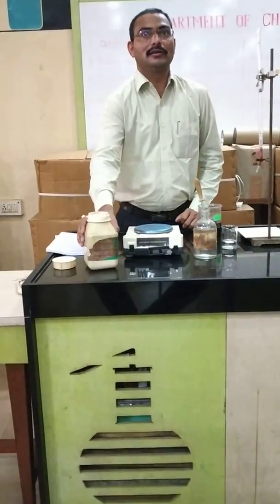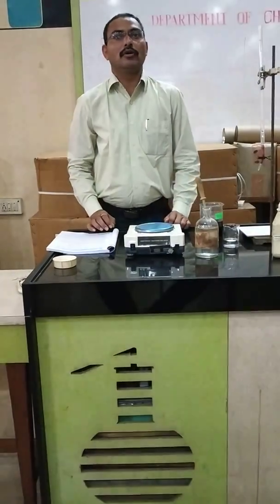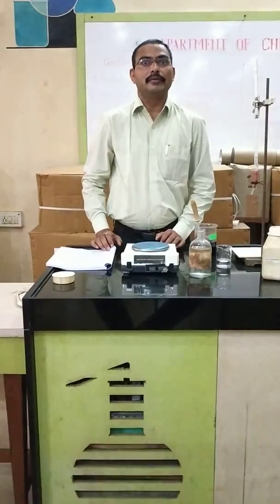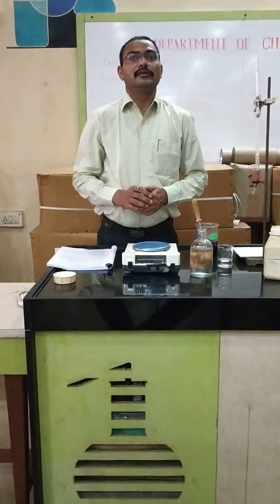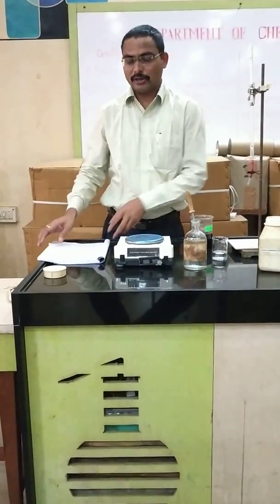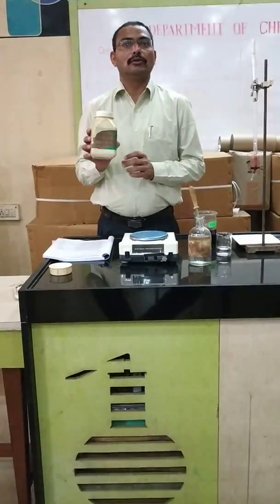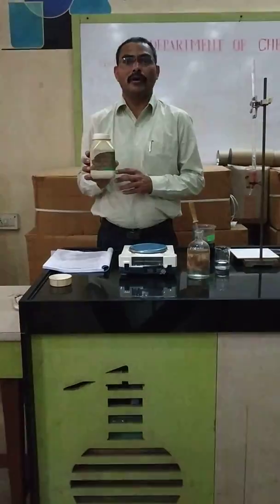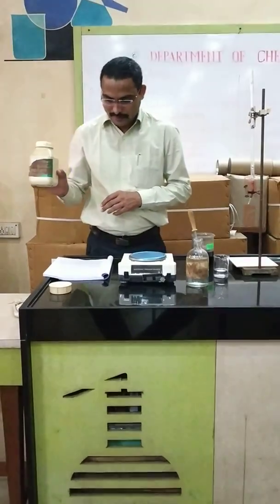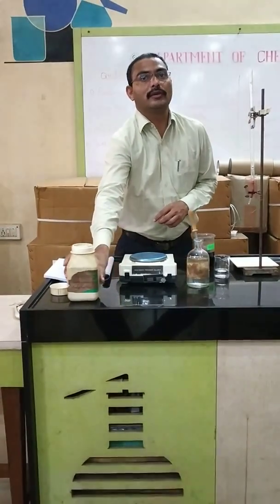This titration is compulsory in our board exam for 10 marks, and this experiment is divided into two parts. The first part is the preparation of ferrous ammonium sulfate. We have to prepare a standard solution of 0.1 molar ferrous ammonium sulfate.